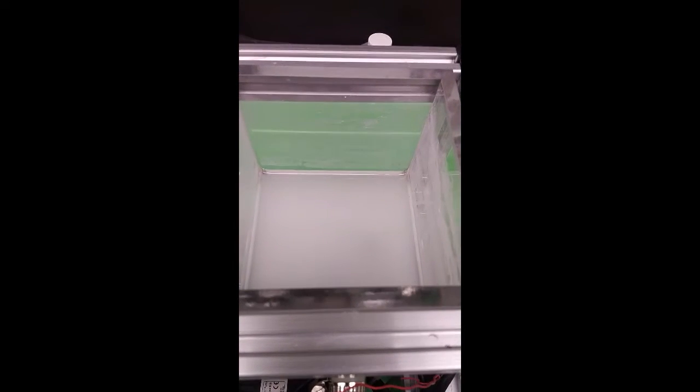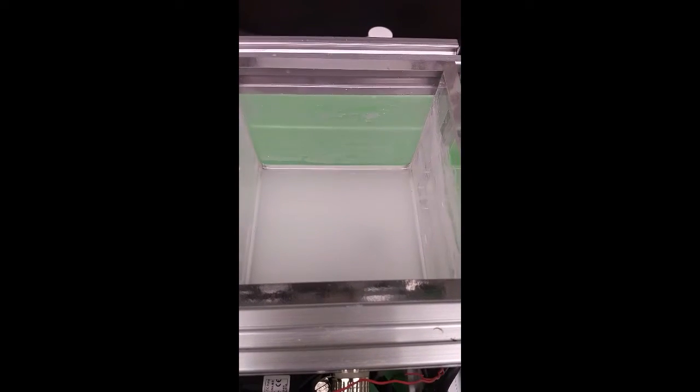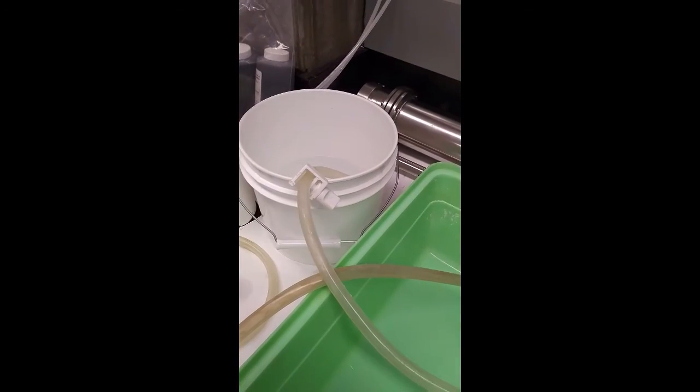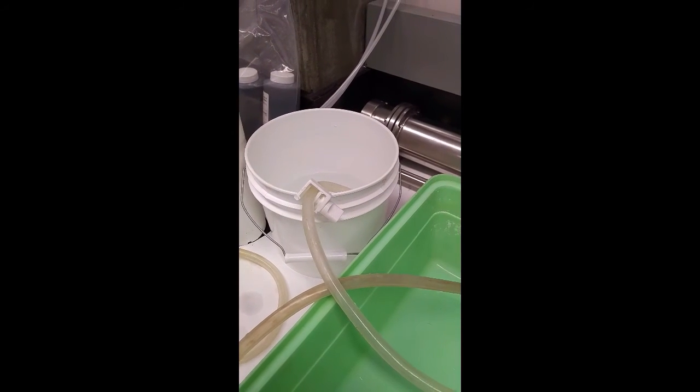There are two tanks. One tank to the right is for the powder skin layer, and on the left is a tank that we can use for the raw water. But typically we actually use this type of bucket for the raw water, as it gives us more capacity.